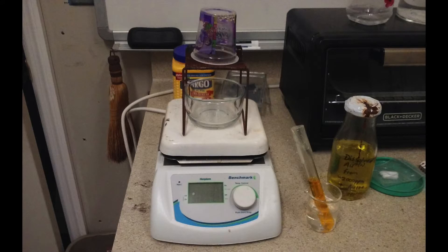And here begins my setup. You can see my old gold solution, which is a lot less concentrated and yellow in color, but the new one is pretty orange because it's a really high concentration. So there's a lot of gold in there to dry out and get gold chloride with.